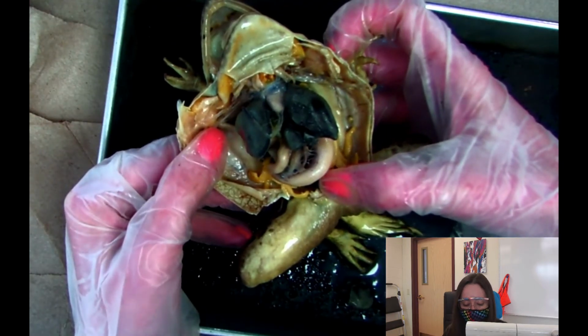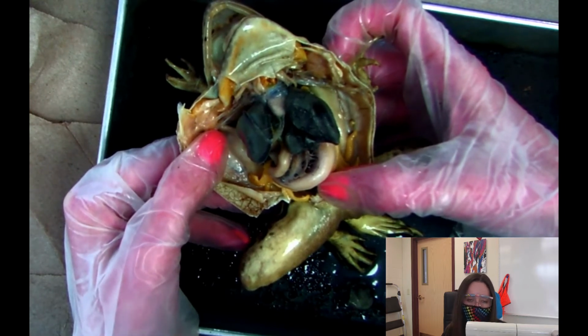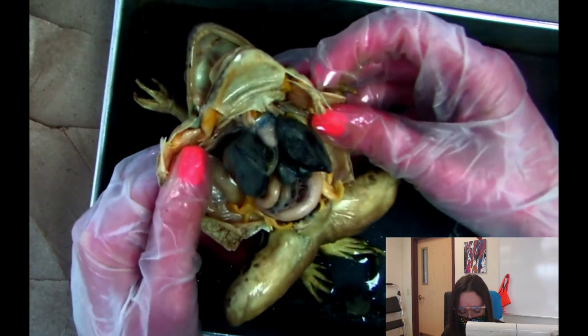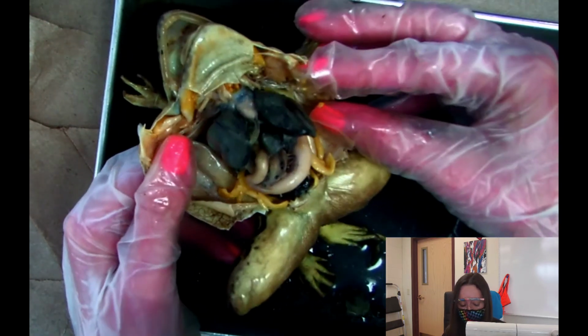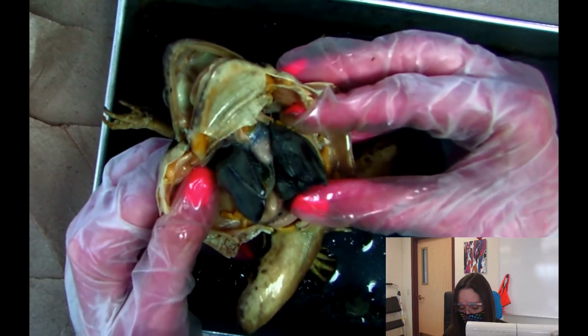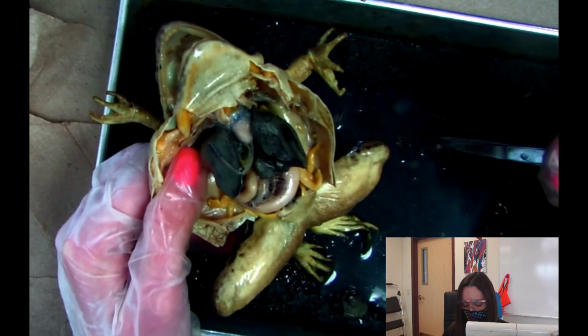And, you know, by the time I take this frog apart, we will be quizzed. You guys will have a quiz on a different frog, basically. And each frog is different. But this is a female because it has eggs. So, not all females, though, have eggs inside of them. So sometimes the female does release them, but this female did not.